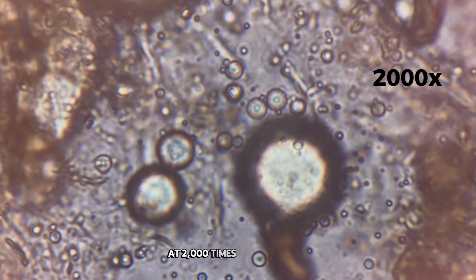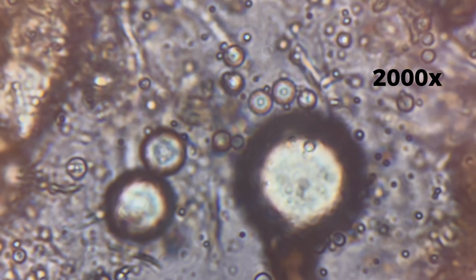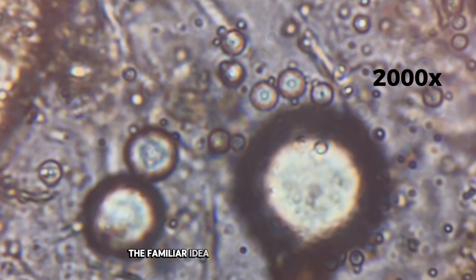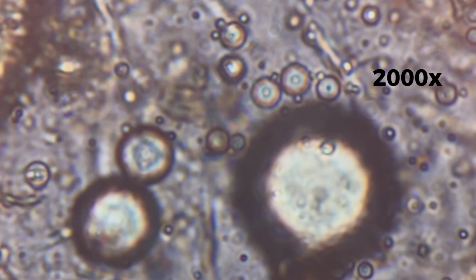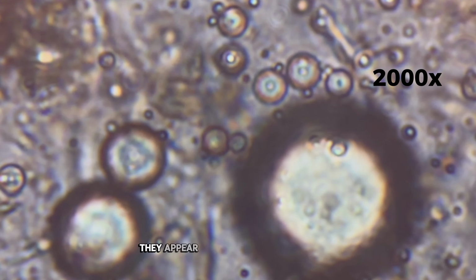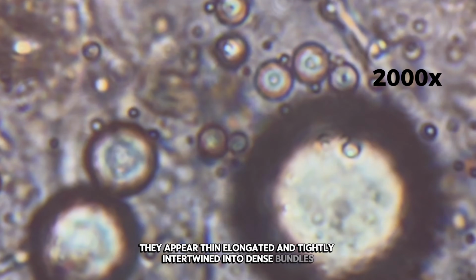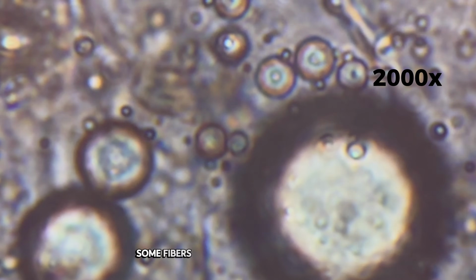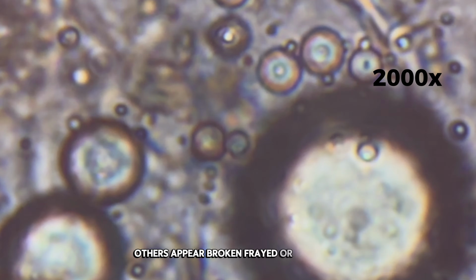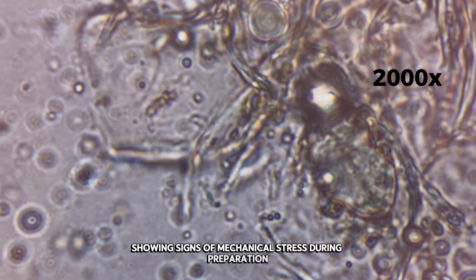At 2,000 times magnification, the olive becomes almost completely abstract. Nothing here resembles a fruit anymore. The familiar idea of food disappears entirely. Individual fibers are now sharply defined. They appear thin, elongated, and tightly intertwined into dense bundles. Some fibers look smooth and continuous. Others appear broken, frayed, or irregular, showing signs of mechanical stress during preparation.